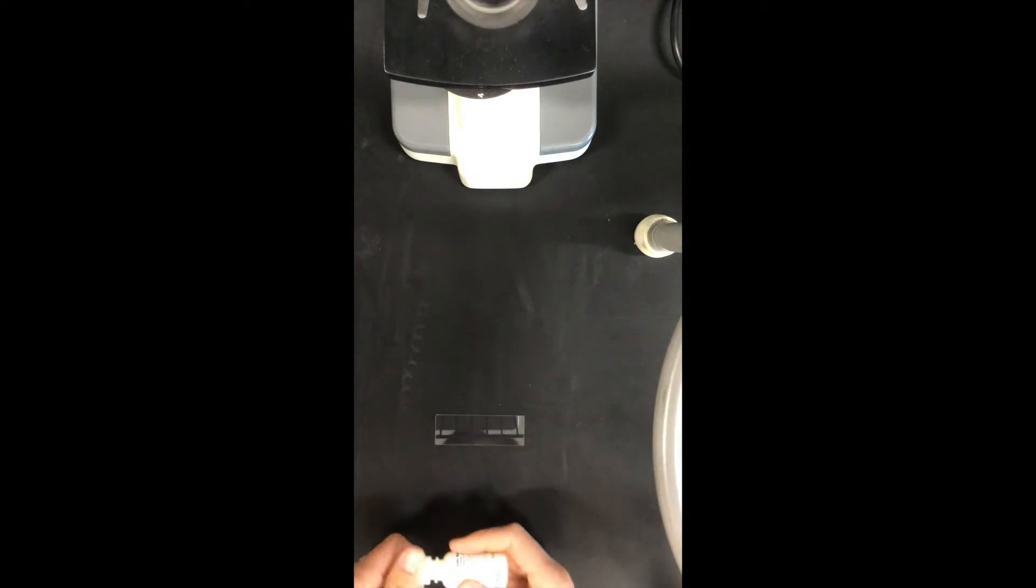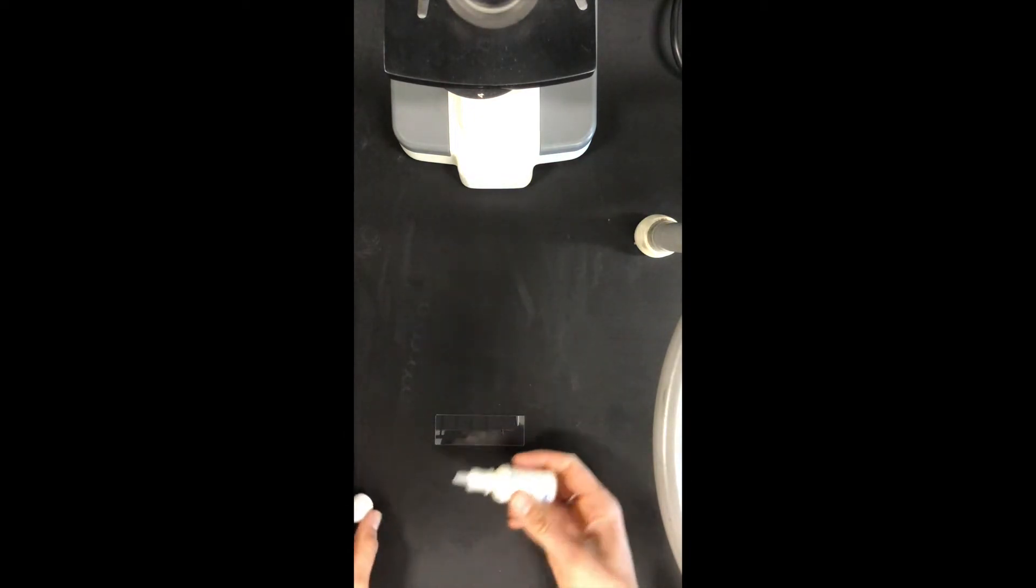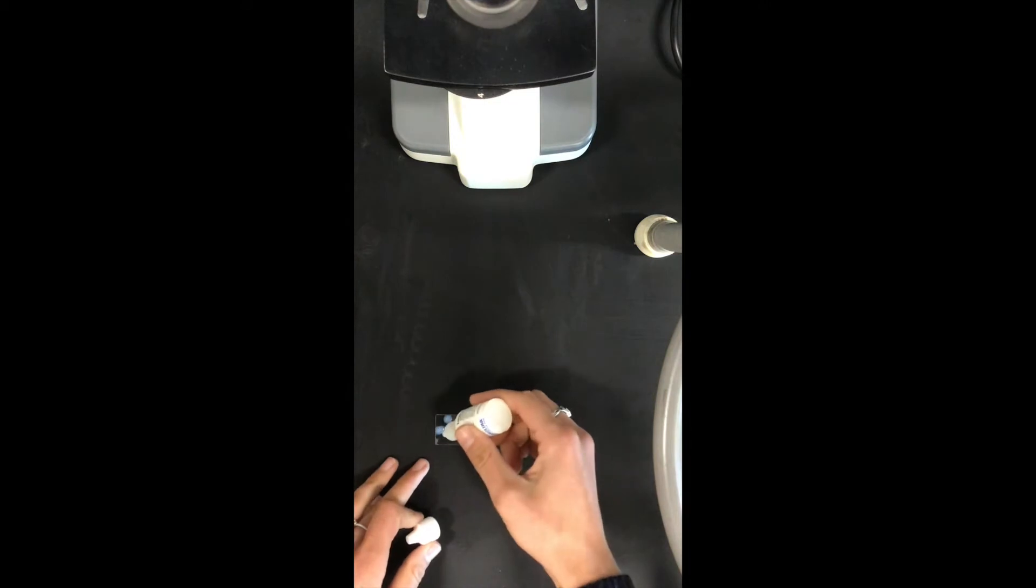So what we're going to do, shake this up, we're going to place one drop of latex on the end of our slide here. So let's do our drop.